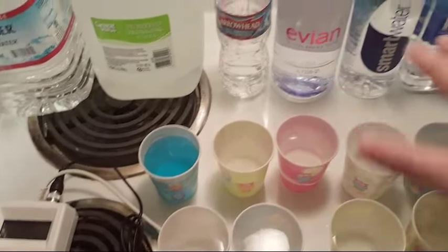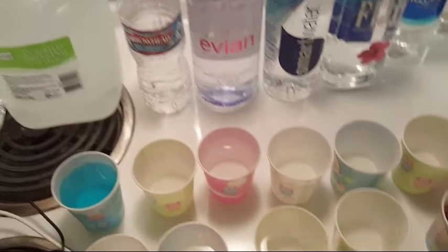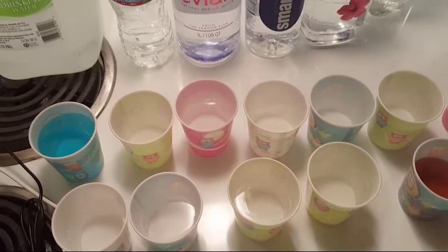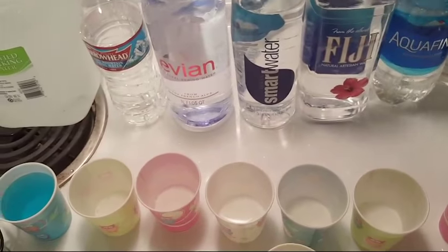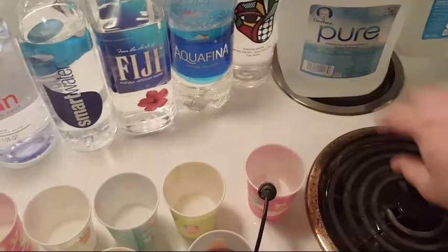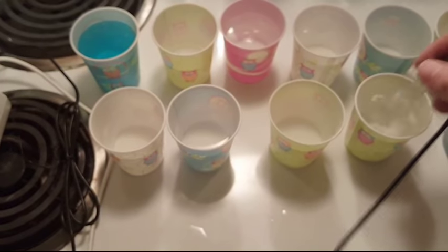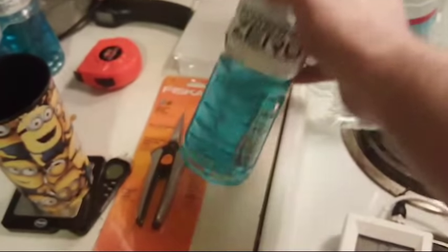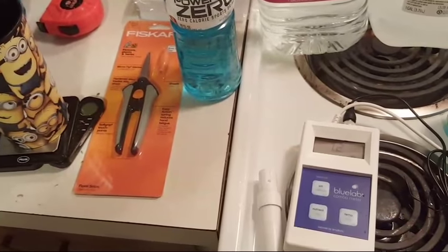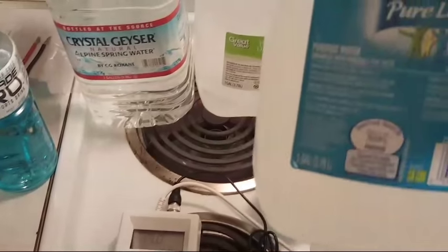The problem is they're really expensive. My phone is running low on power so I may not finish the video without plugging in. I already know Aquafina is acidic, Life Water is acidic, and Gerber Pure Water has a lot of minerals and is right around 7.0 — really good. This one — Powerade — was like 2.6, almost like acid, though it changes in the body. Beer is very acidic, right around 3.4 to 4.0. Same with soda. Now let's check out Nestle Pure Life.